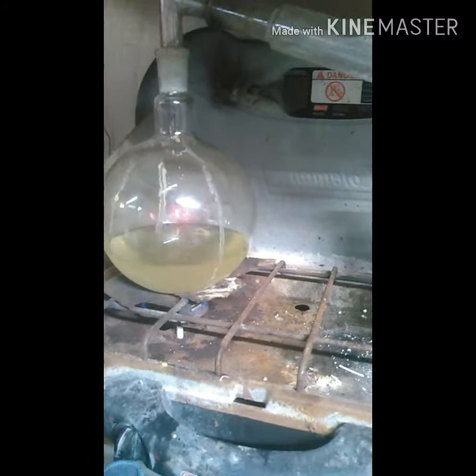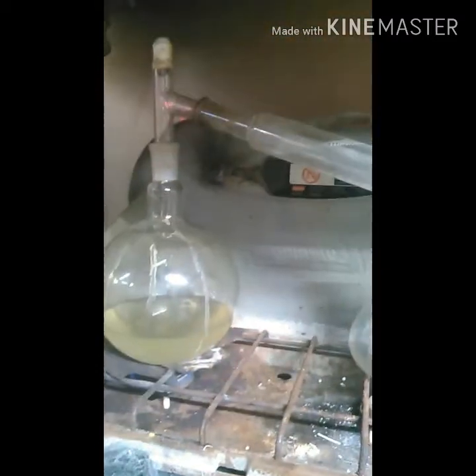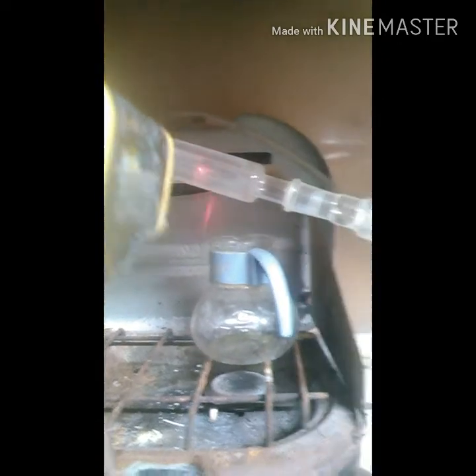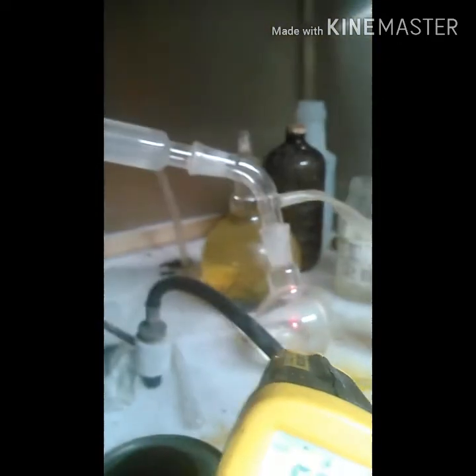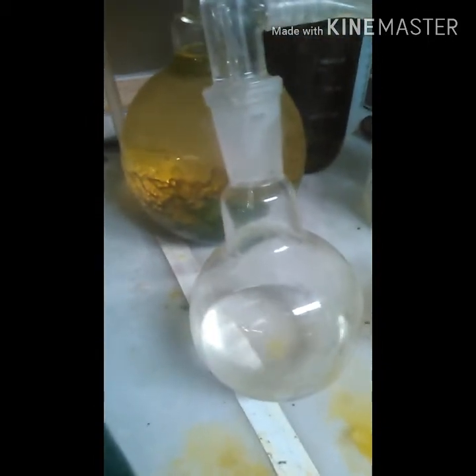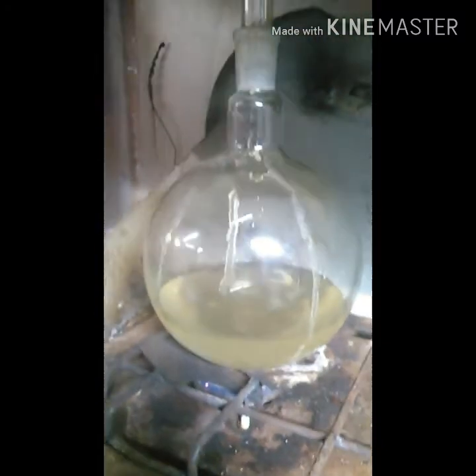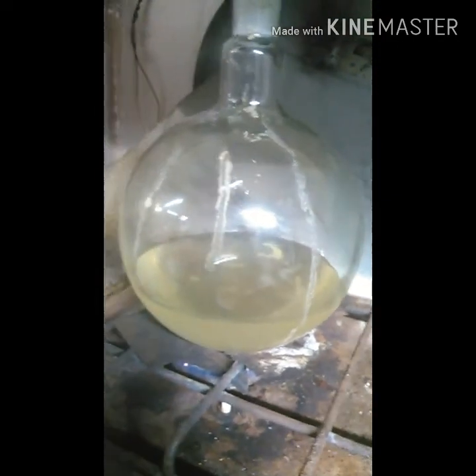In the top right I'm at 84 degrees, now 73, 63, 59, 60. You can see it's dripping away and not boiling, and I've got a tiny flame down there. It's just at about a little over 80 degrees — that's the perfect temperature for it at negative 28 vacuum.